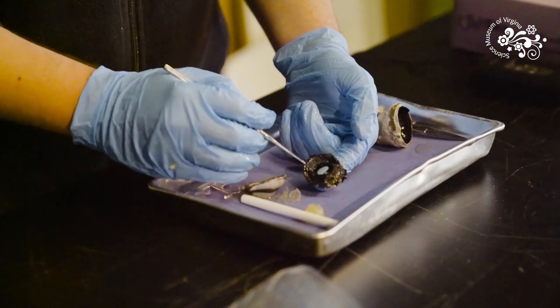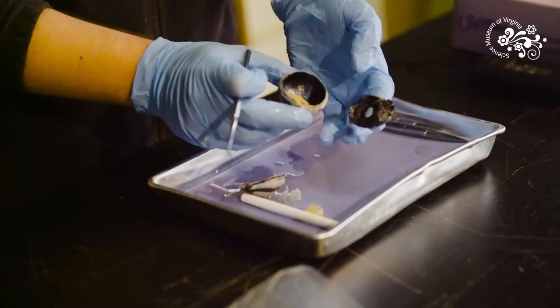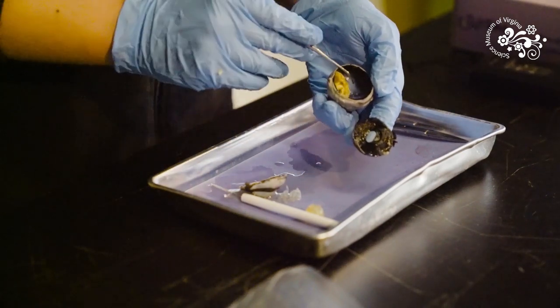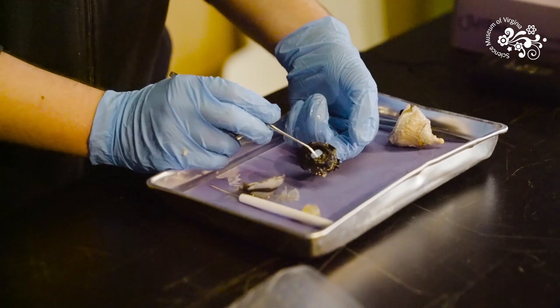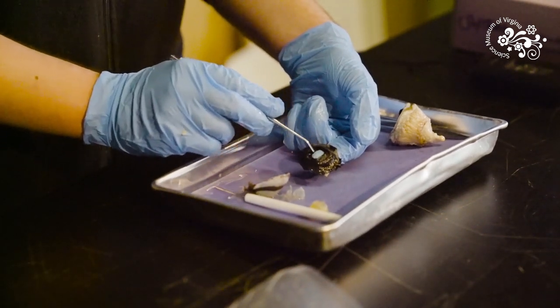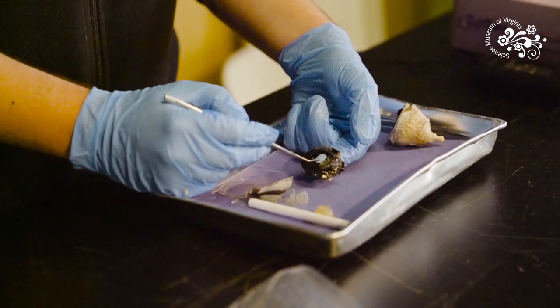You can imagine that if it's really bright outside you have plenty of light to go around, your pupil gets smaller. It constricts that opening to protect the really sensitive rod cells in the back of your eye. But if there's not enough light for your cones to do the job then your pupil will dilate and that hole will open up to let more light in so it can shine on more of your retina in the back of your eye. One difference we can see between cow and human eyes is that cows have these little sideways oval pupils. Humans have circular pupils. Cats have cat eye pupils. Different pupil shapes are slightly adapted for different functions like the cat eye pupils, very good for nocturnal animals. These sideways oval pupils are very good for animals looking out for predators sneaking up behind them. But it all does the same basic function of controlling how much light gets to the back of your eye.